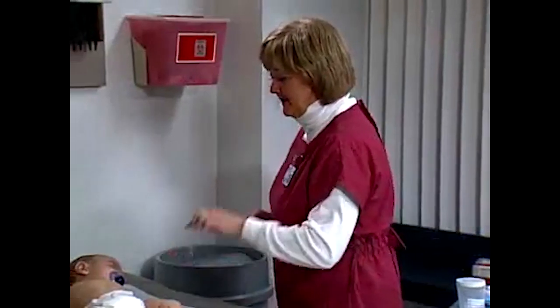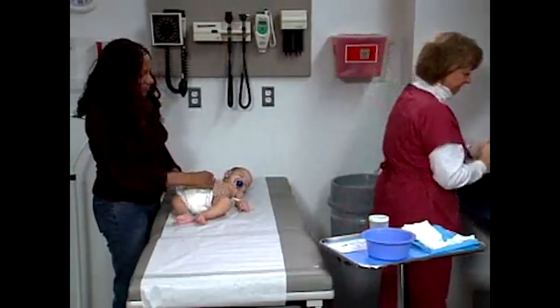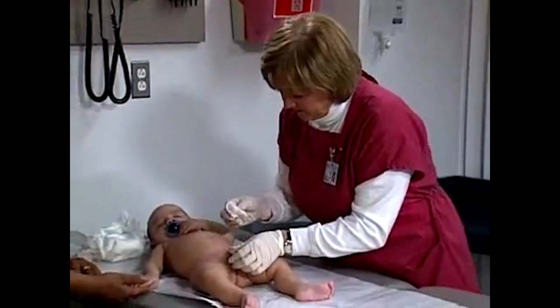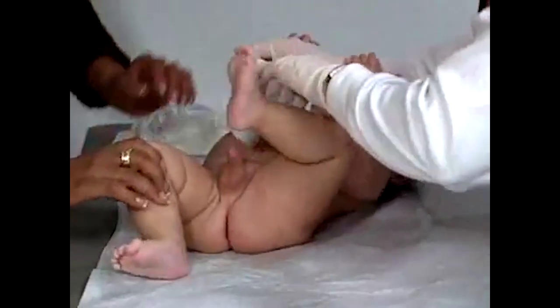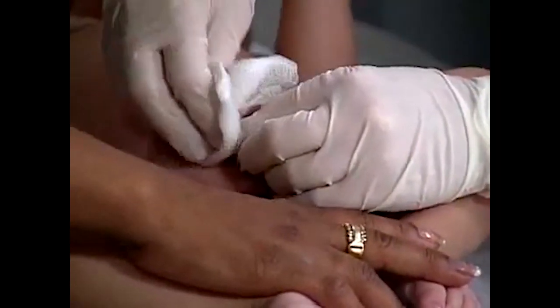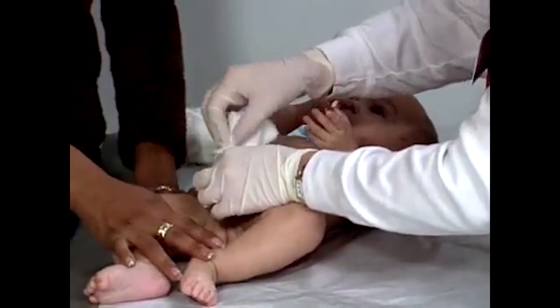For pediatric patients, the medical laboratory scientist must: 1. Wash hands thoroughly with soap and water. 2. Use povidone iodine swabs or any antiseptic to clean the urethral area. On boys, clean the tip of the penis in a circular motion working out from the urinary opening. On girls, use one wipe on each side of the labia, wiping from front to back, and a third wipe directly across the urinary opening. For uncircumcised males, retract the foreskin before cleaning.